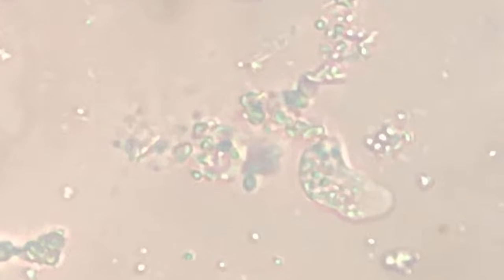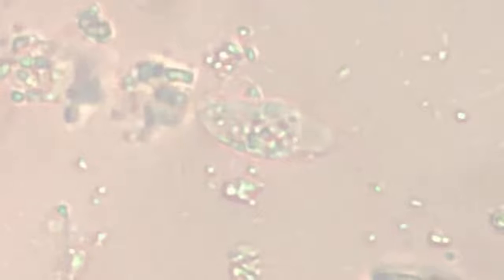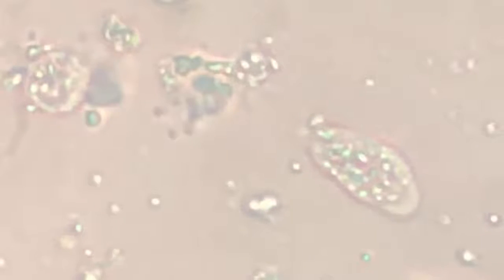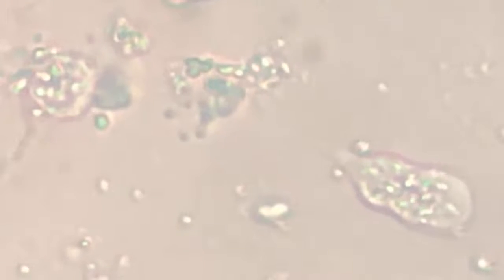Can we zoom in a bit more? I'm unable to see the nucleus, though there's a lot of algae and bacteria inside this individual. Focusing is a little tricky because it's under 40x and 10x, that is 400x, and then it is magnified by the camera lens. I don't know how much the camera magnification is, but given the size, I think it should be somewhere around 700-800. Even the bacteria are appearing very big.